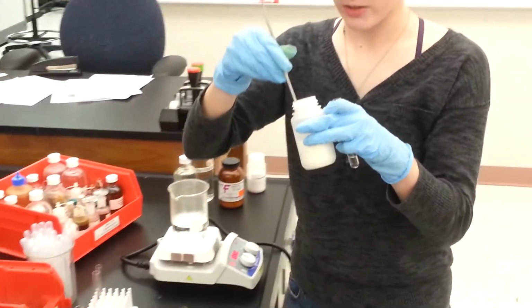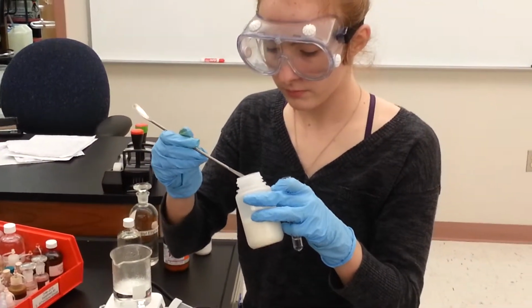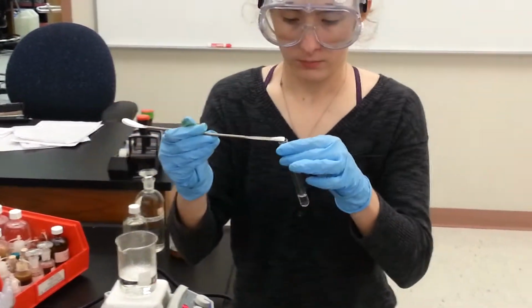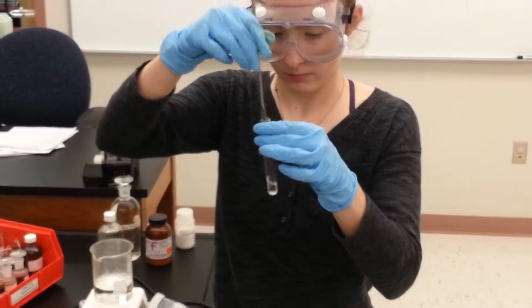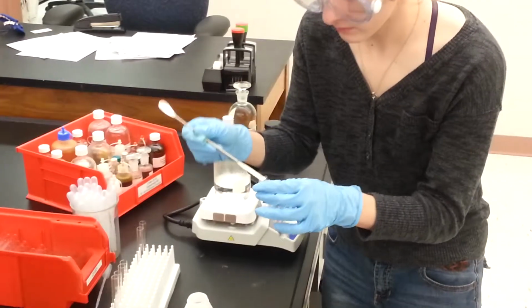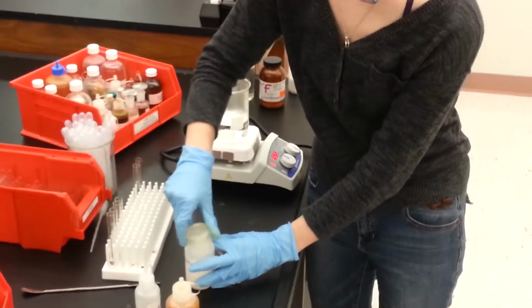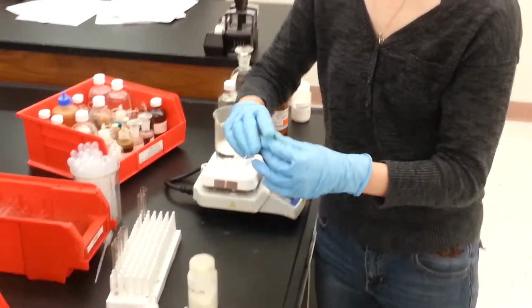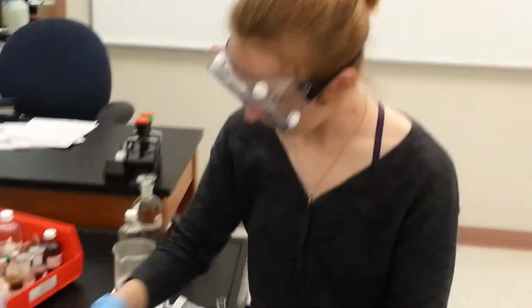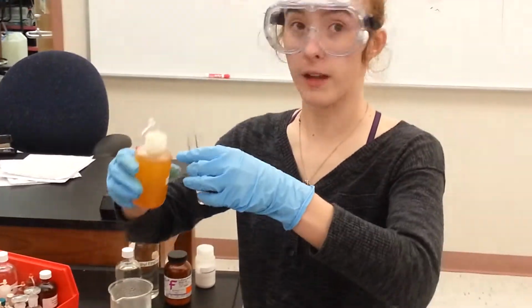You don't need a lot of it, just a little bit. So now you wash with water. Now the other 90% of that 10% is water. So that's why. Now add just a little bit more, just for good measure. Just mix it up a little bit just to make sure it's all together. And then all you have to do is add just a couple of drops of the ferric chloride and it will react.